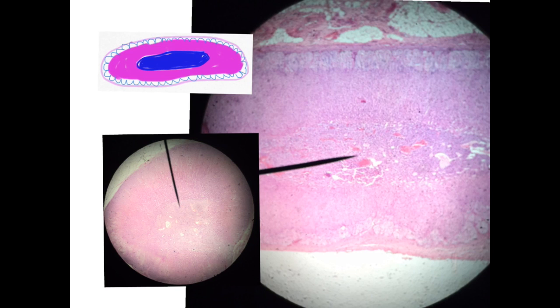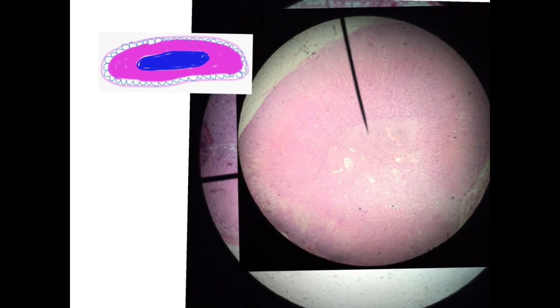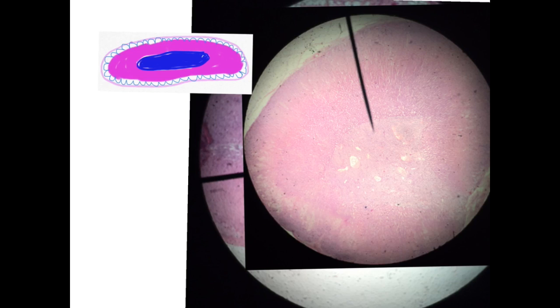Also the other section, also for the suprarenal gland, but it is not so oval, it is a bit different, not rounded or oval, but the most important thing is the appearance of the zona glomerulosa, and this is the fasciculata, reticularis, and the medulla with the blood vessels inside.